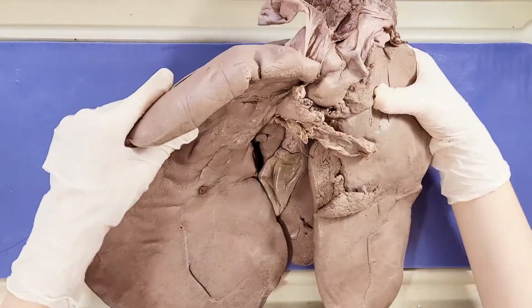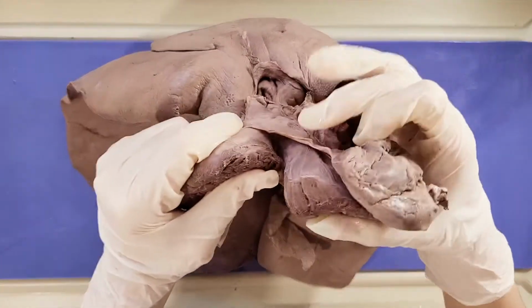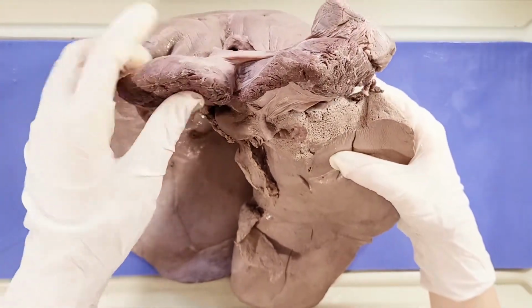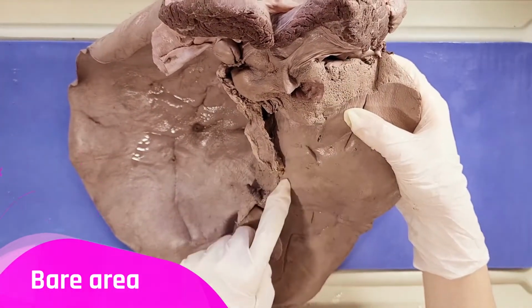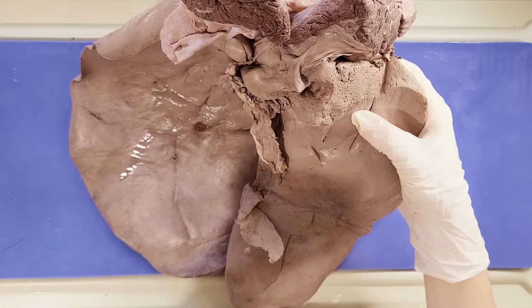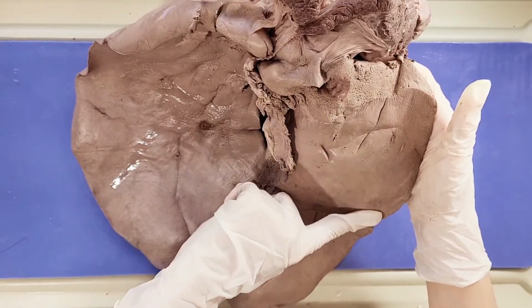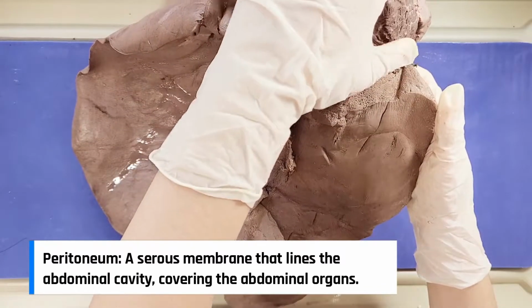So another important thing to note is that the diaphragm, right here, stretches right over the superior surface of the liver here. So here's the diaphragm. And actually in this triangular part of the liver, called the bare area, the liver is attached directly to the diaphragm by loose connective tissue. And this is why you can see that the texture of the bare area is a lot rougher than the rest of the liver here, which is a lot smoother because it's in contact with the peritoneum.